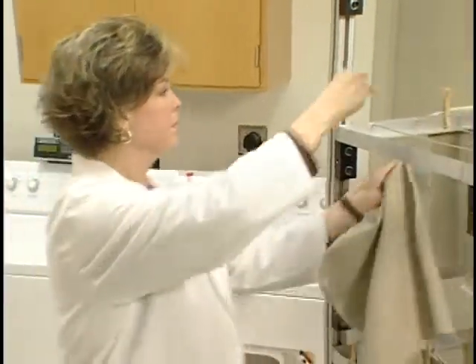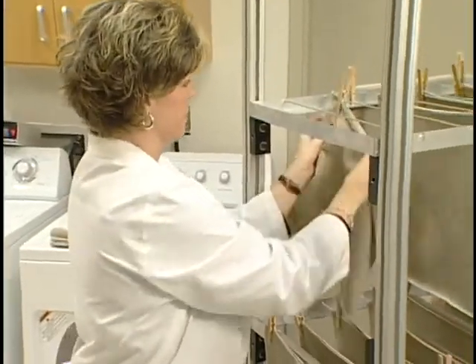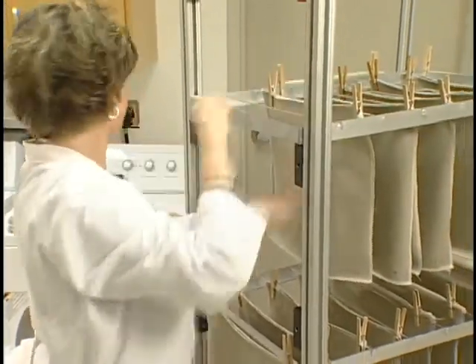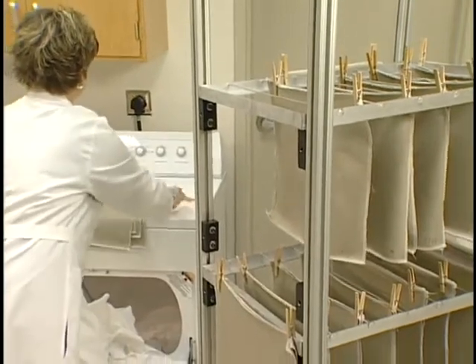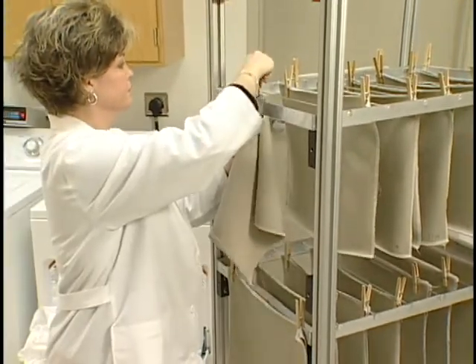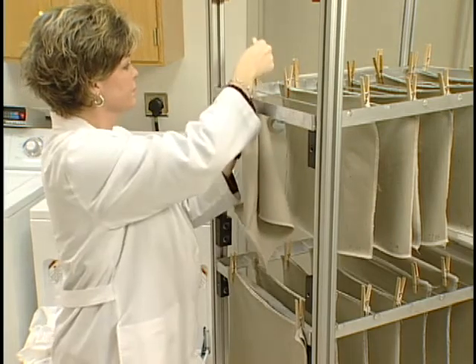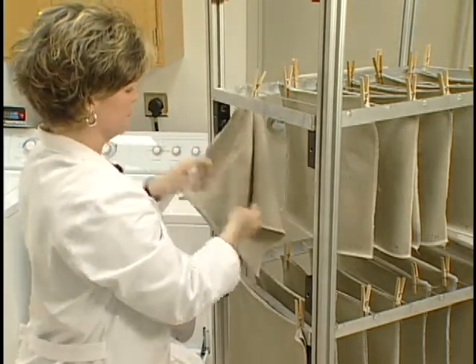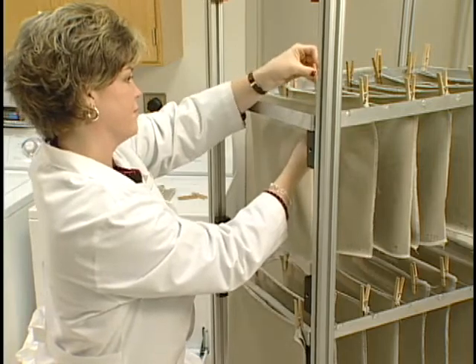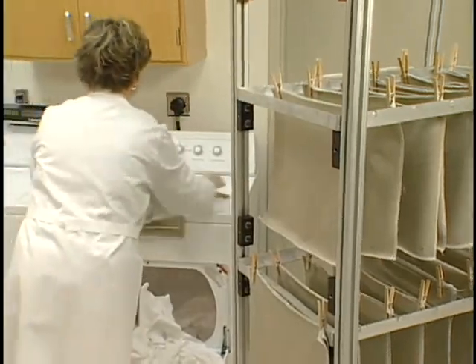After drying and prior to evaluation, the specimens are hung vertically on a wire for conditioning. The time, temperature, and relative humidity required are clearly stated in the ASTM Test Method D1776, Standard Practice for Conditioning and Testing Textiles.